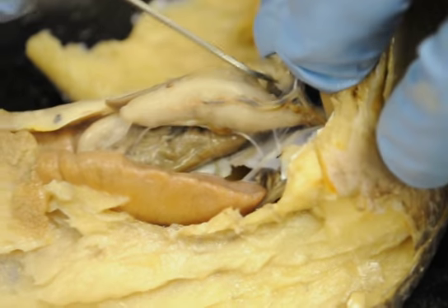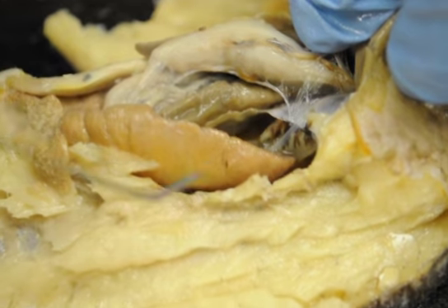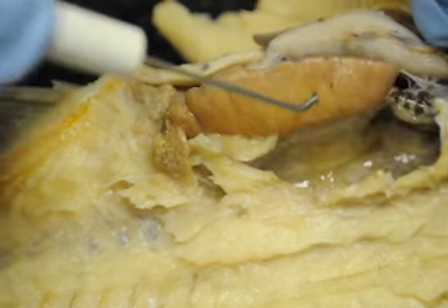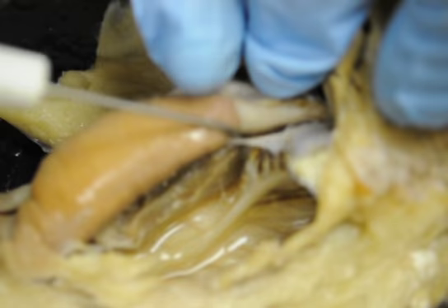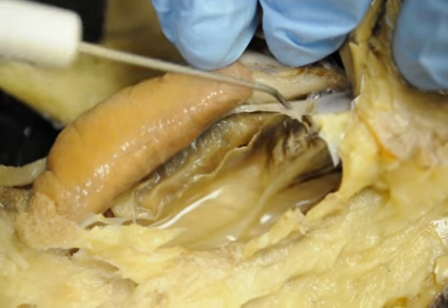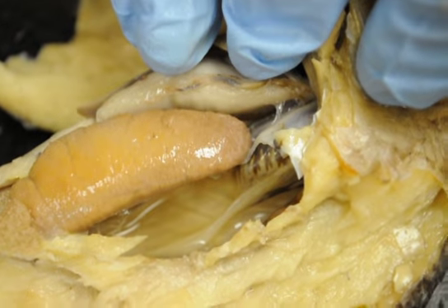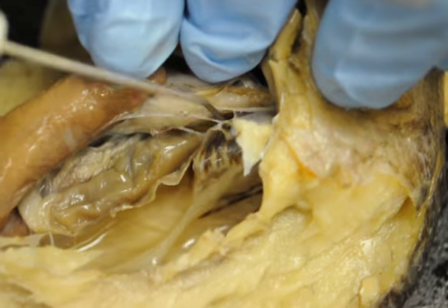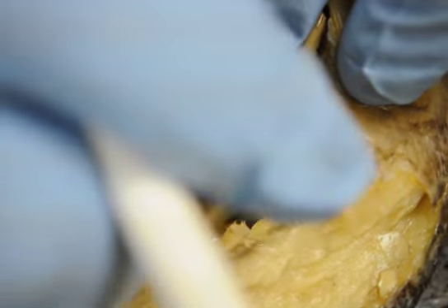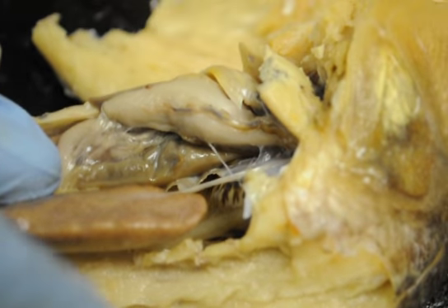Now when I move that out of the way, I actually can get in here and see this little sac right here. I'm going to lift the gonads up, and this little clear sac right here, it's already busted, is the swim bladder. All this right here was the swim bladder. You will damage it when you're trying to cut this away. Invariably you'll do some damage to it, but all this is a swim bladder that I've cut away right here. Now when I move this out of the way, I can see my stomach and my pyloric ceca.